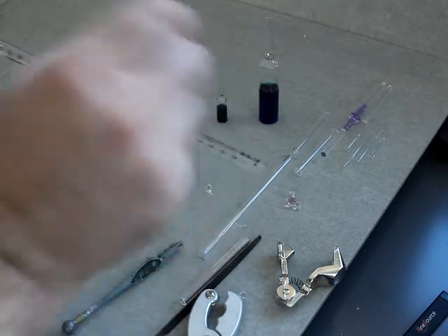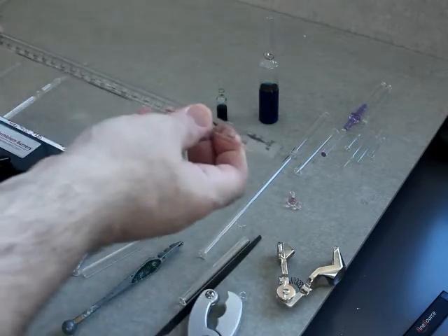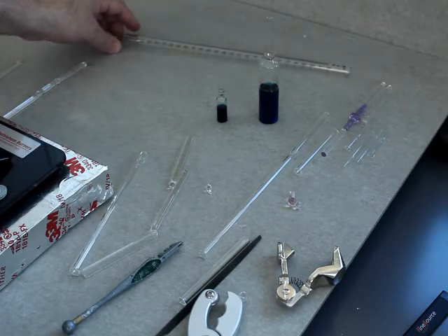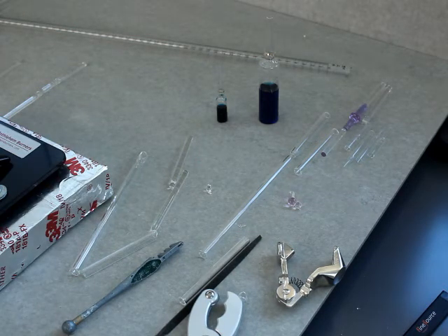These are fundamental skills that you as a chemist — I'm assuming if you're watching this, you're a chemist — you want to have. If you're a professional glass blower, you should not be watching this because my technique is terrible.